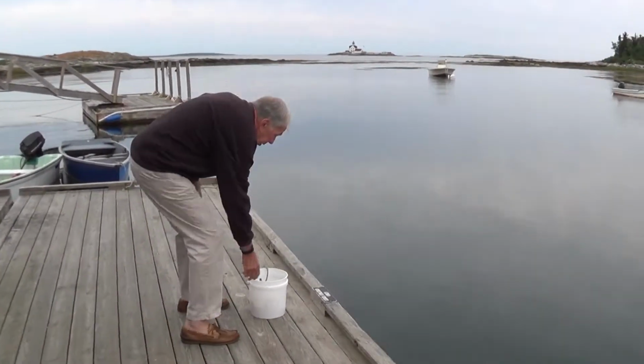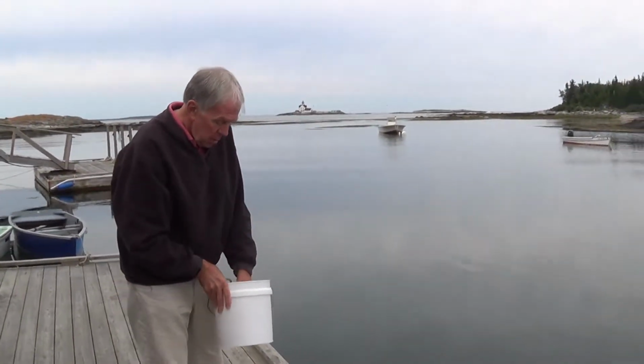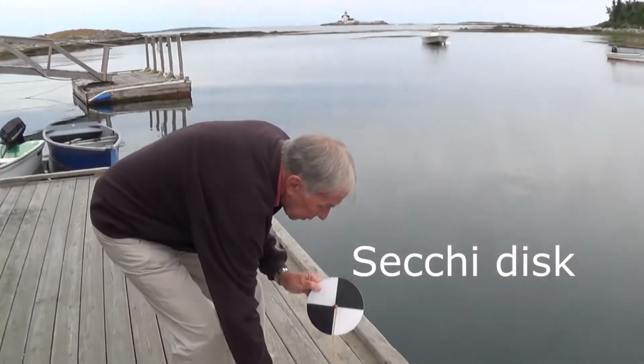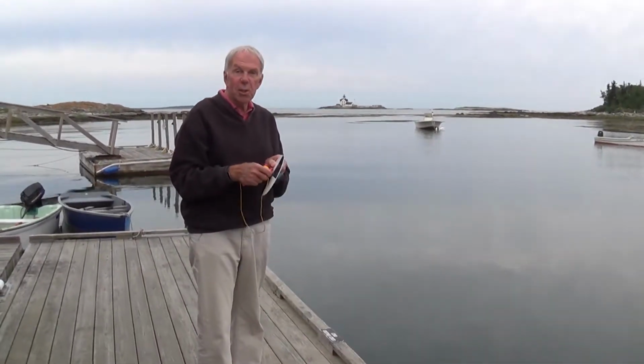That's always included in the bucket that you have. And this is what a Secchi disc looks like. There's one important thing you want to do with this. This line is a little bit slippery. Sometimes the knot gets loose.